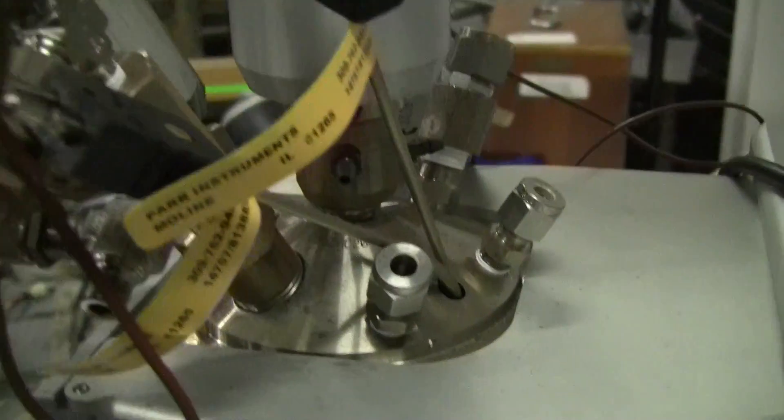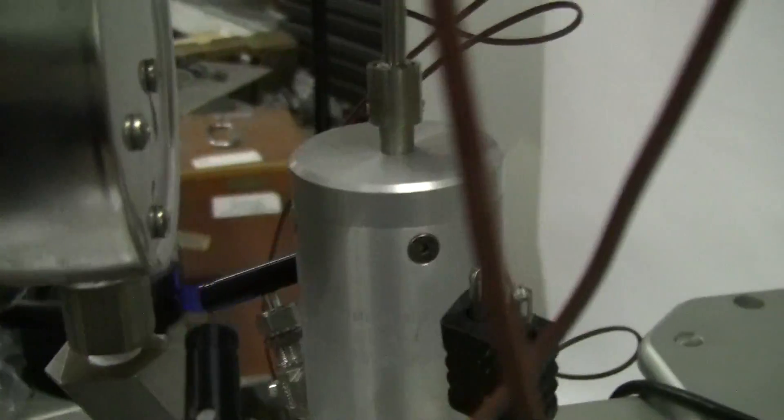Introduction valve, back of the head, motor coupling.